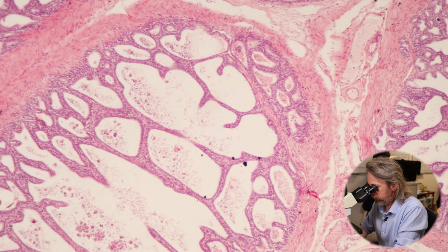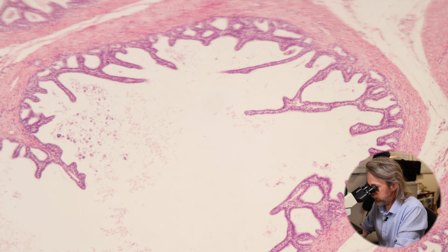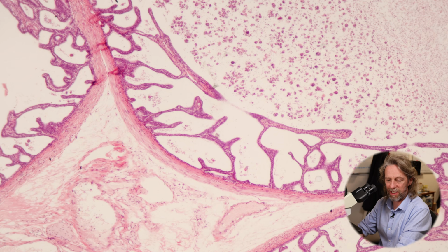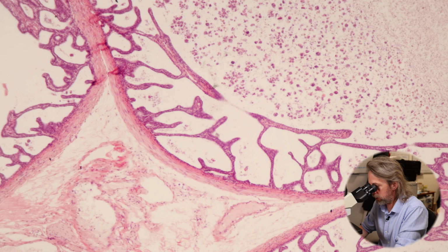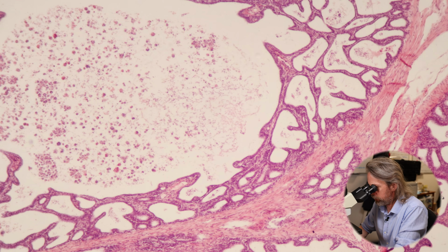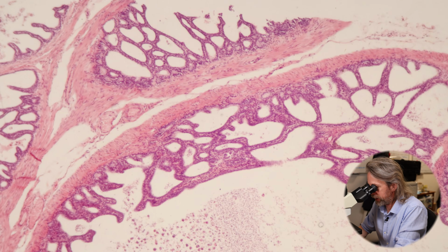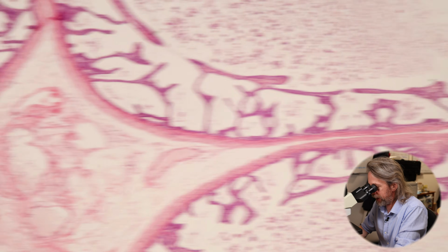So this is the seminal vesicle, does the same job. This gland produces more fluid than the prostate does. They both produce slightly different components of semen, so you kind of need your seminal vesicles and your prostate for fertilization to be really likely. But we're seeing a very similar layout, aren't we?